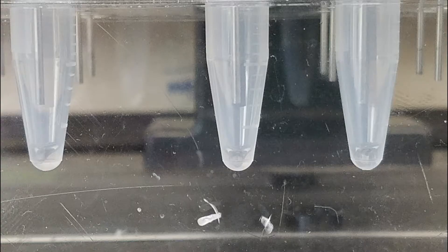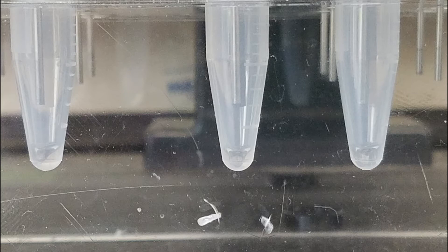The goal is to achieve a slight dimpling in the liquid, which I have exaggerated for you here, without flinging sample around your tube. As samples dry, you may have to adjust gas flow and needle position to maintain that slight dimpling in the surface of your sample.